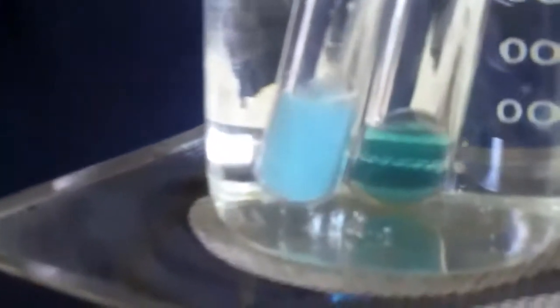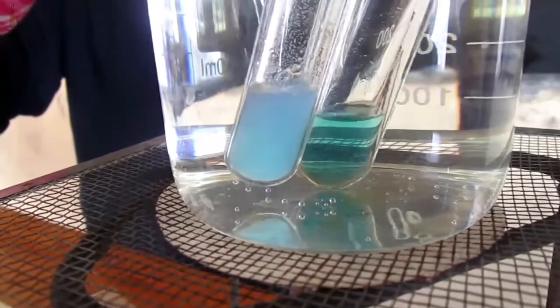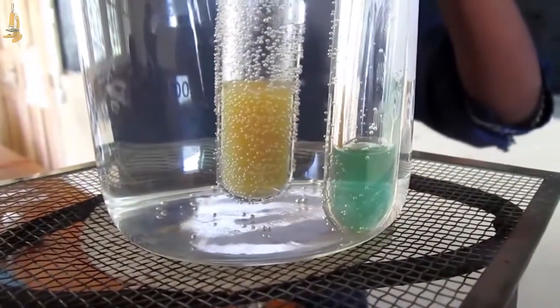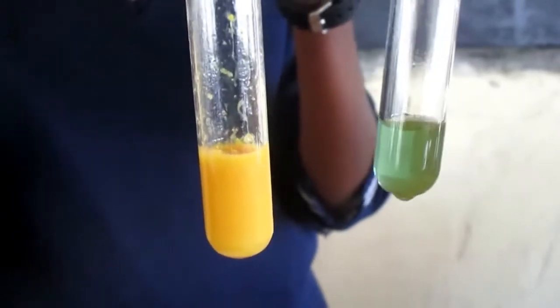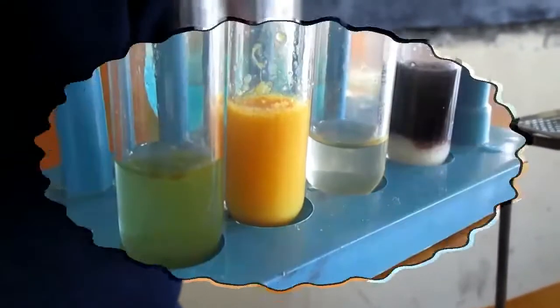We put it in the boiling water so as to observe the color changes. The color will start to change from blue to green, green to yellow, then yellow to orange. As you can see, our color starts to change — after yellow it starts to come to orange. The color change goes from blue to green, green to yellow, yellow to brick red or orange. This sample has the presence of reducing sugar because it changed color, while the other one does not have reducing sugar because it does not change color.